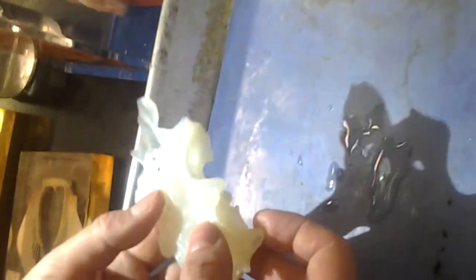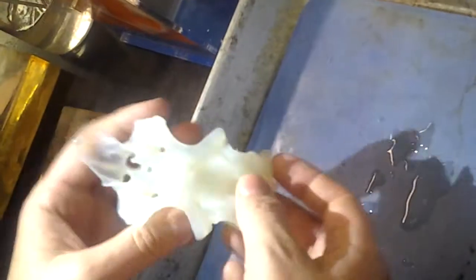This is in the front, right? Towards the front. This is all the orbit. So the antorbital is the front of the orbit, postorbital is behind the orbit. So the eye sits right in here, between the postorbital and the antorbital.